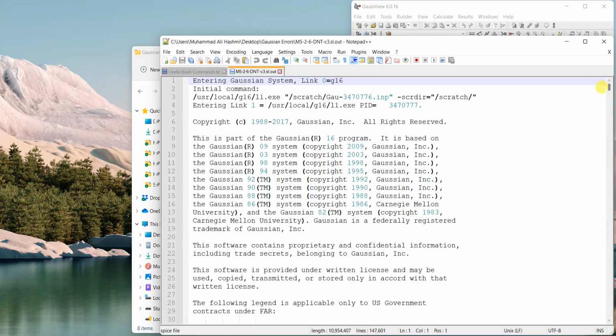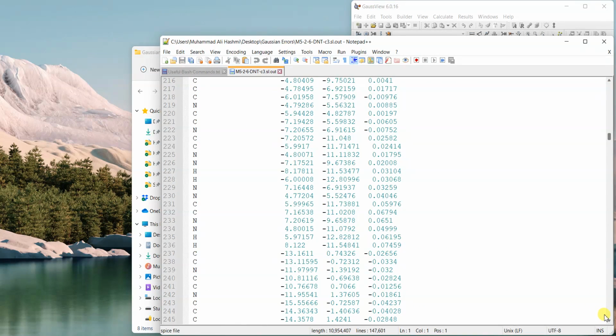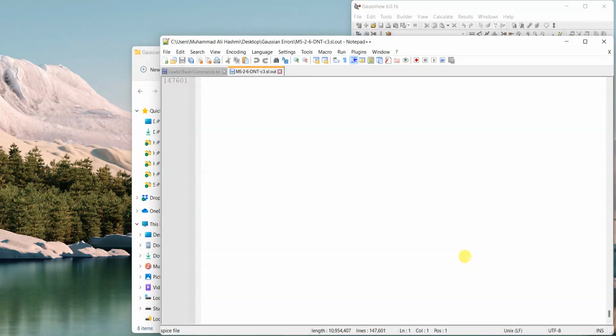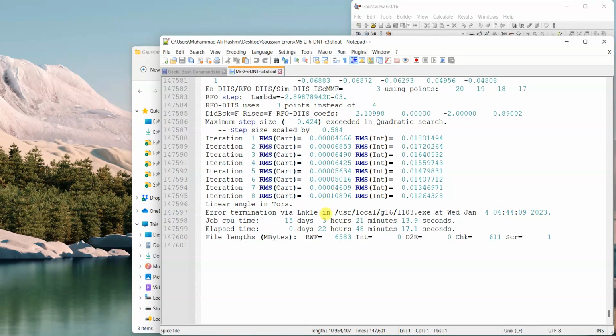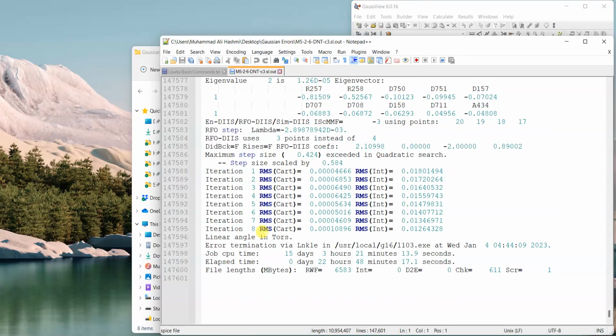So let's have a look at the last file. What's in there? Move to end. So this is kind of the same error, but it's just that the calculation is going into a linear fashion, like quadratic convergence. SCF is converging through a quadratic convergence system. So that is why this error is shown in this way.